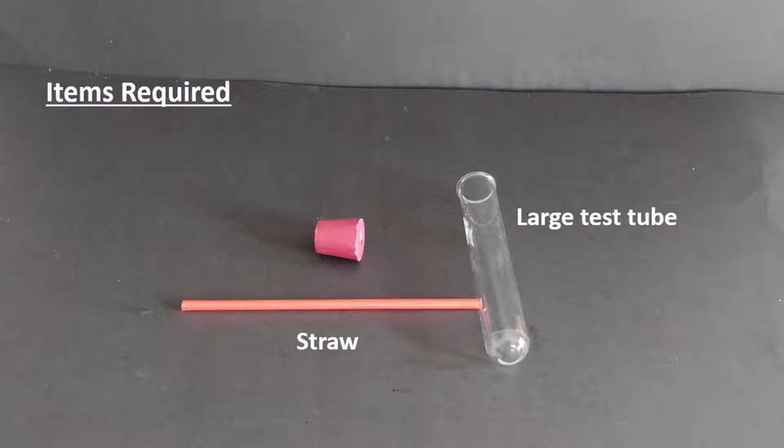Additionally, to test the nature of the products of the reaction, we will require a large test tube and a straw.